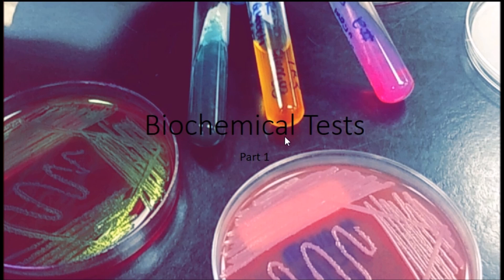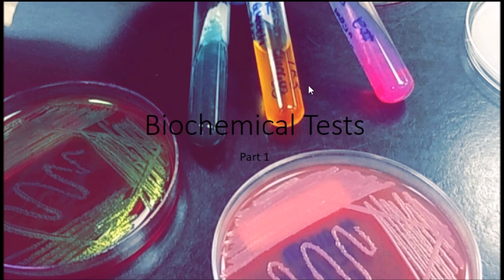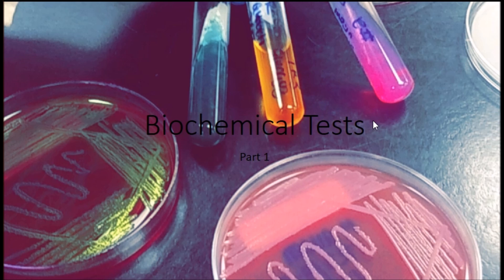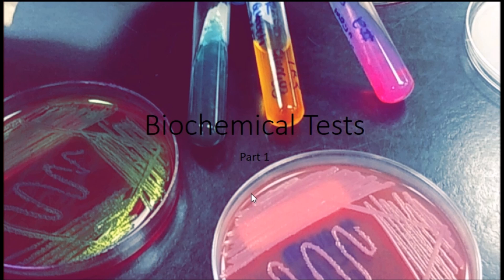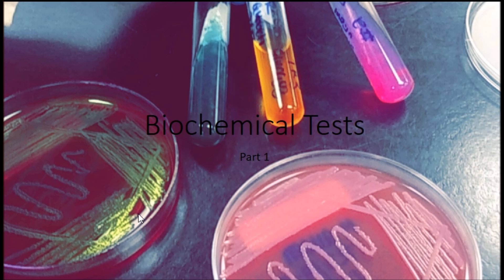To start, we're going to look at some of the biochemical tests. This is going to be a part one series — I'm just going to cover six or seven tests that are most commonly used in microbiology labs.